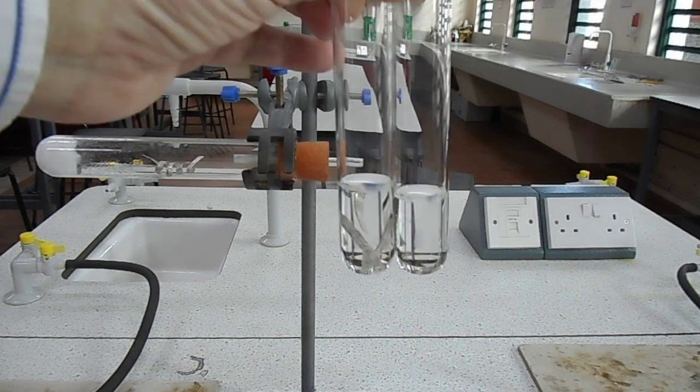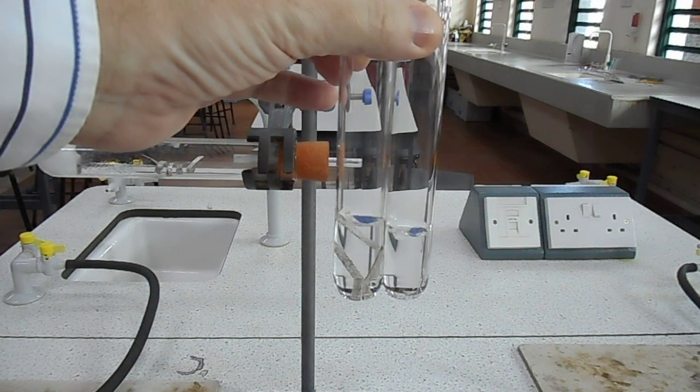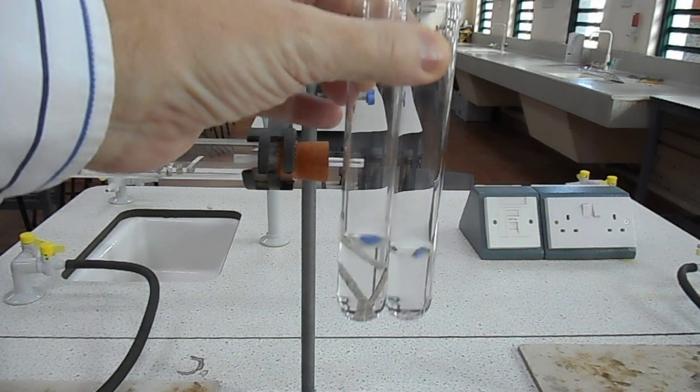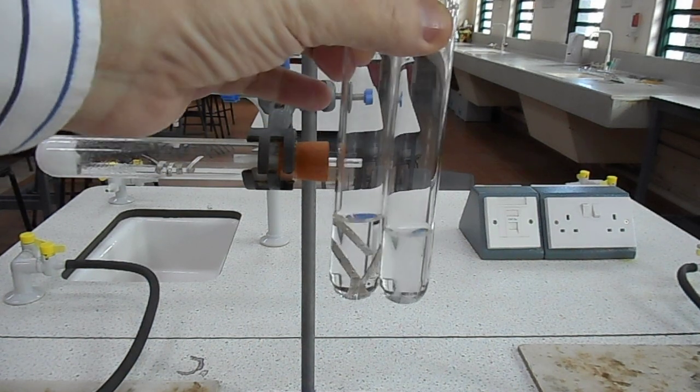By comparison, if we add a little calcium to water, as soon as the oxide layer on the outside is removed you can see it reacts rather quicker.